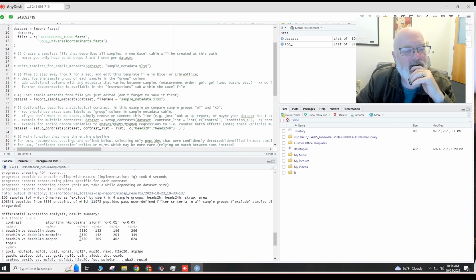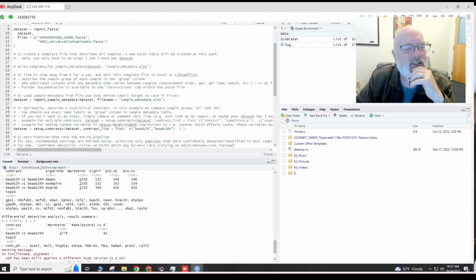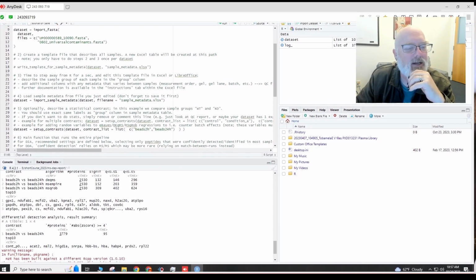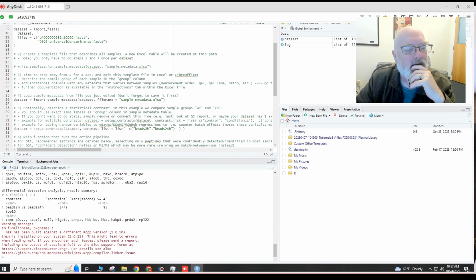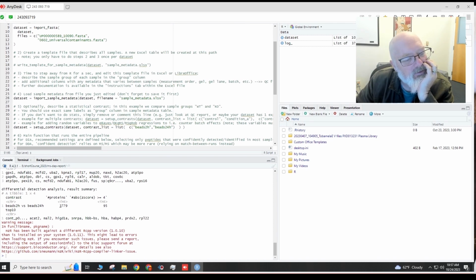So it had 105 samples, 4 groups: bead digest 2 hours, 24 hours, S-Trap, and urea. It gives you some statistics here. It does these 3 differential expression algorithms, DEqMS, MS-EmpiRe, and MSqRob. I have to go back and read the papers about that. I'm not too familiar with them. Gives you some log files, gives you some warnings. It doesn't look like the warning is very serious. I don't know what that means.